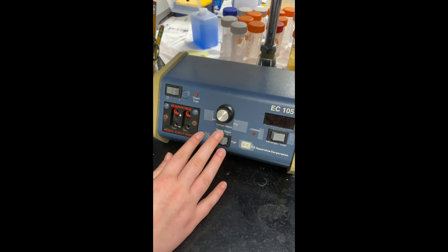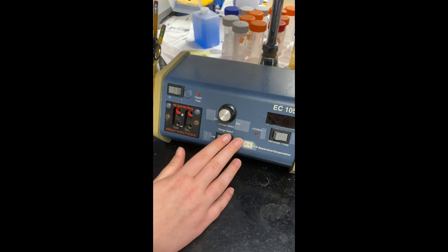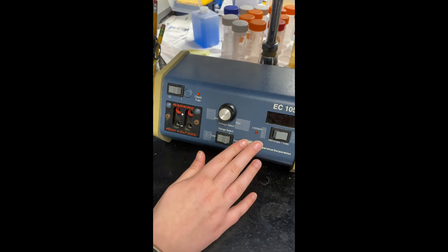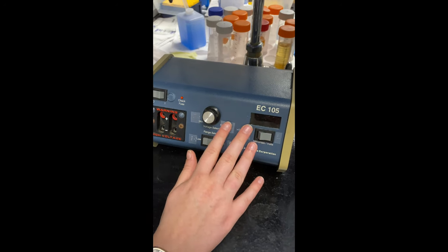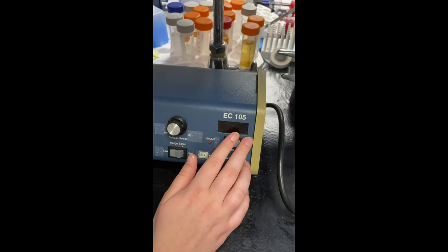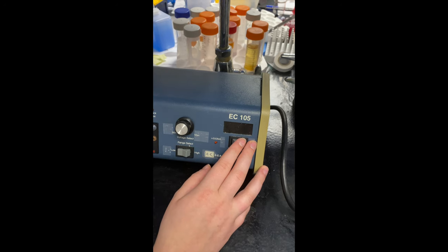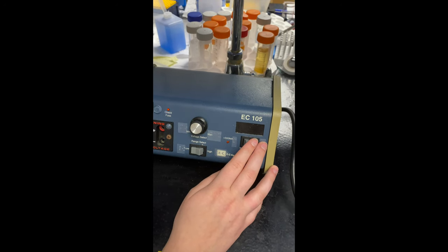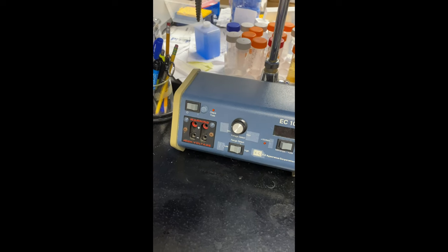There is also another switch. We put a braille label on the left side that says low, and of course we put one on the right side that says high. And we have an M for milliamp and V for volts, and that is to change your modes. Is there anything else that should be discussed about this setup, Caroline?